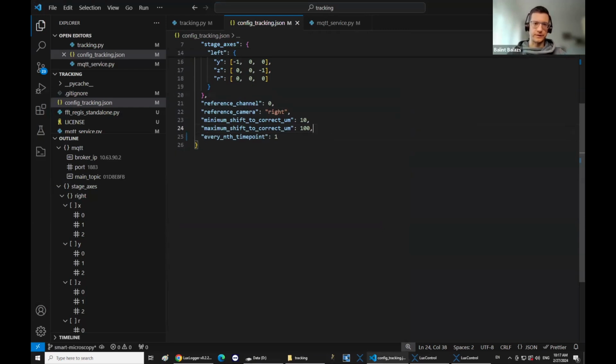to do the registration. And then you can specify what should be the minimal shift to correct. Of course, there will be some noise, so you don't want to correct every little jump. So this would only send a message to the microscope if the shift is more than 10 microns. And sometimes the registration can go wrong, and then you have some really big jump and you want to avoid it. So you also have this maximum shift that can be corrected would be 100 microns in this case. And then of course you can change it depending on your field of view, what makes sense. And this is what you asked about, Rafael. You can also configure how often this registration should run, so every time point or every second, every fifth, whatever.